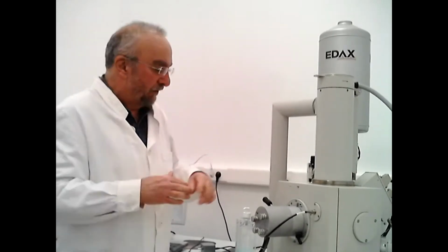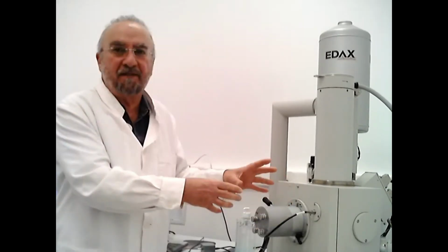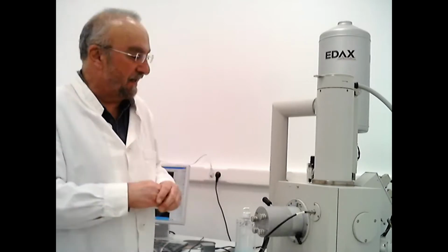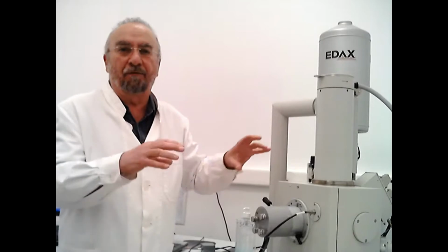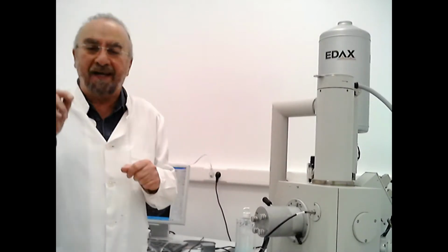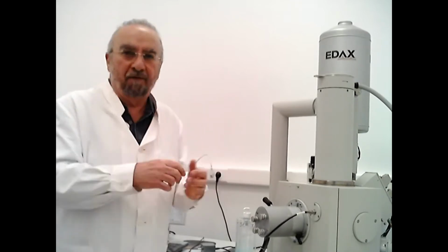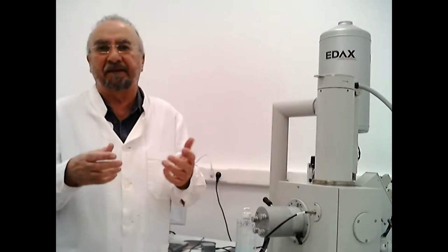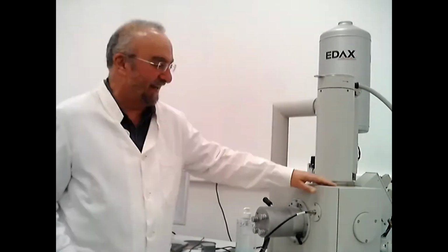The materials over here, I've got about 4 specimens in here, and I will show you how they look in the electron microscope. When we are playing with the electron microscope, we can see tiny details, but more importantly, we can analyze what we see. We can analyze the elements that they contain, if they're oxidized, or if they're metals, if they are organic materials. We can analyze lots of things. So this is one of our right-hand tools, let's say. It's a very important tool.